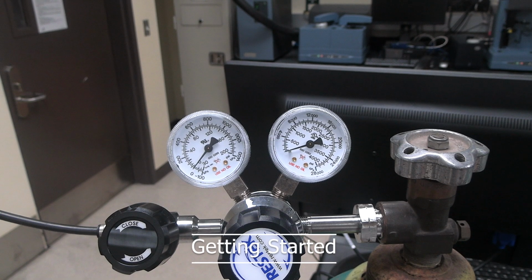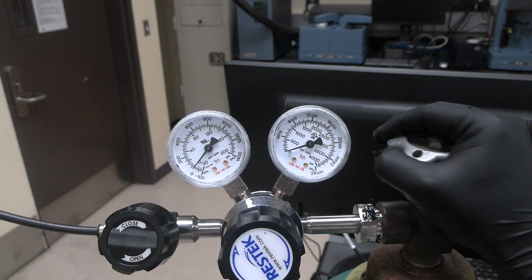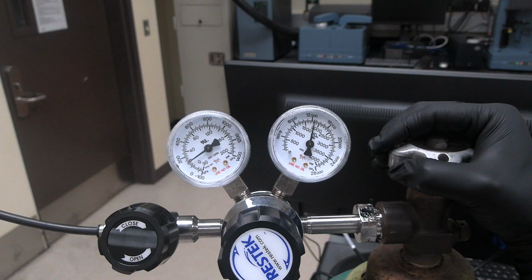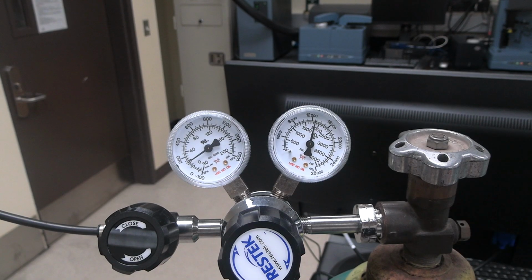Getting started. Open the compressed air cylinder, located opposite the instrument behind the GPC, by turning the knob counterclockwise a quarter to half a turn. Check the left outlet pressure is 25 to 120 psi. Check the right cylinder pressure is greater than 250 psi. Note, if the pressures are not as indicated, tell your professor or the scientific instrument specialist.